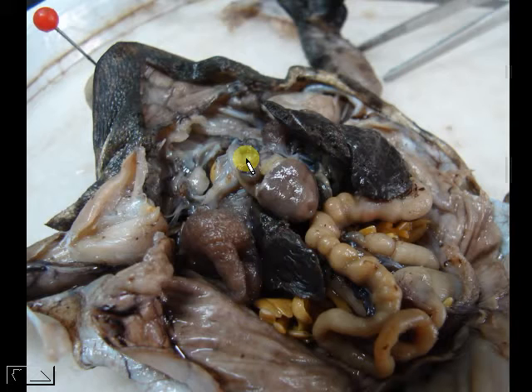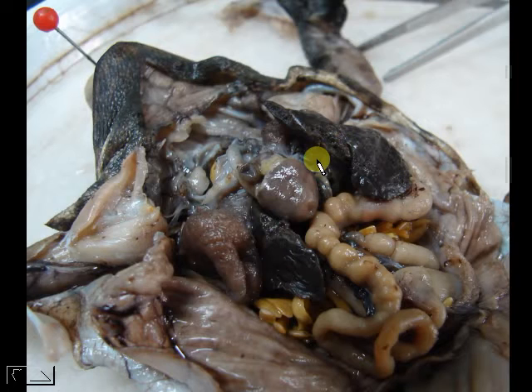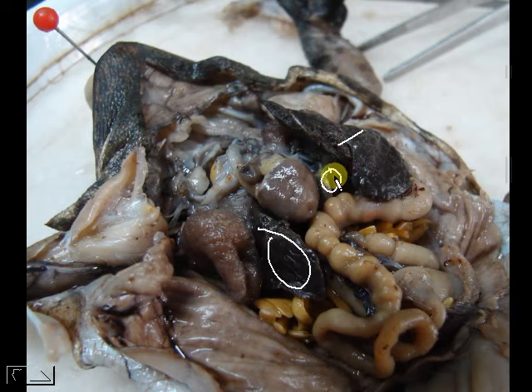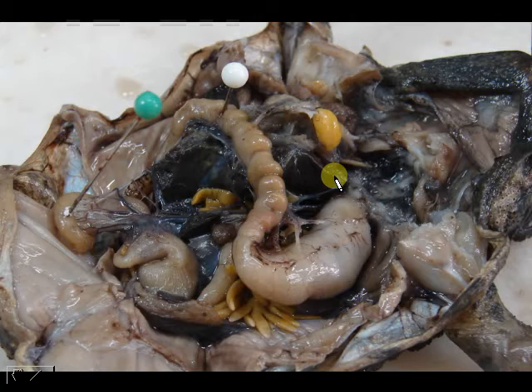When we talk about the digestive system, we are going to look at accessory glands and the actual gastrointestinal tract, or the GIT. The GIT is where the food passes, whereas your accessory glands — like your liver and your gallbladder — secrete certain substances that help in digestion.